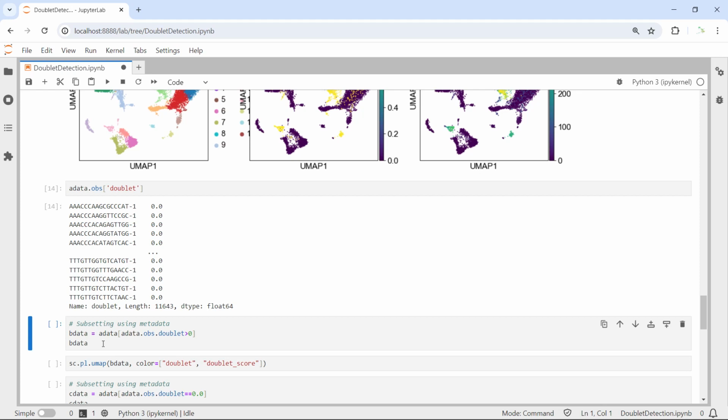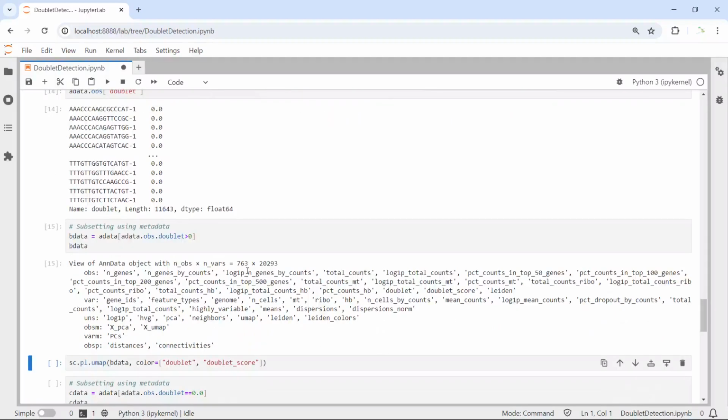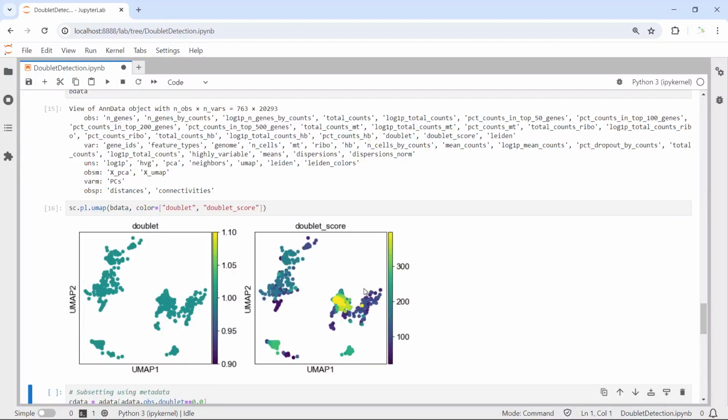We can subset it as bdata for demonstration. Let's subset the doublets. You can see here we only have 763 cells when labeled as doublet. We can generate a UMAP for all the doublets. Let's run. You can see here, left hand side are the 763 doublets, and the right hand side are the UMAP for the doublet score.